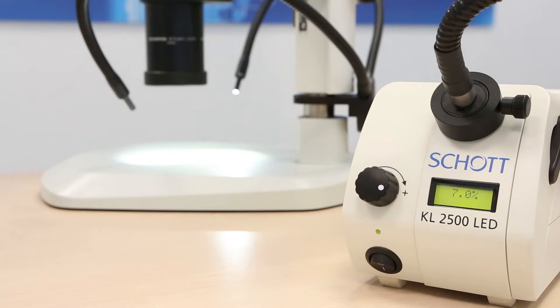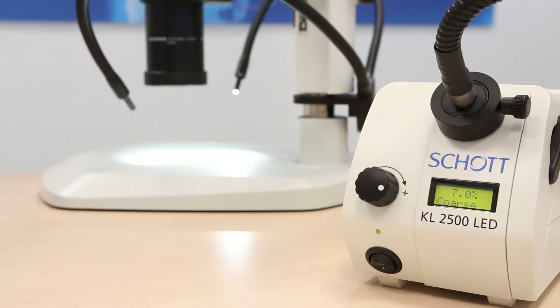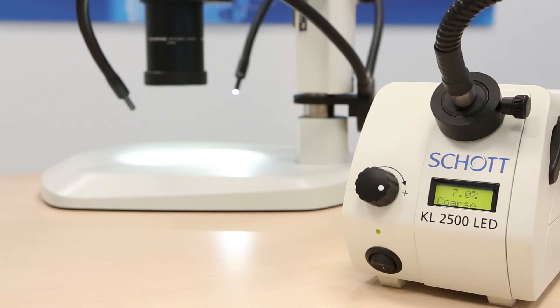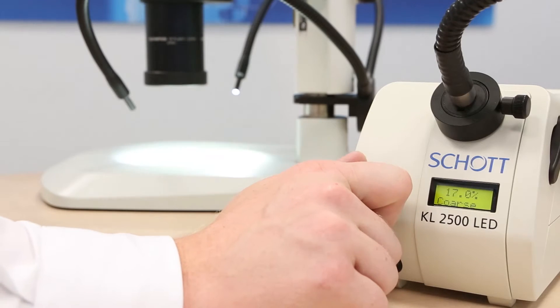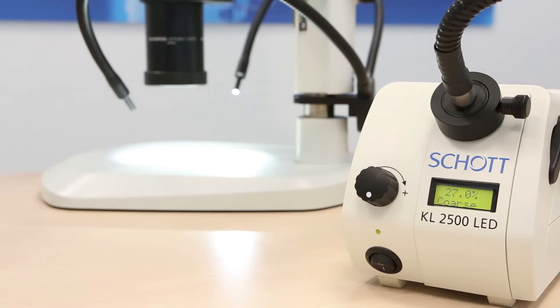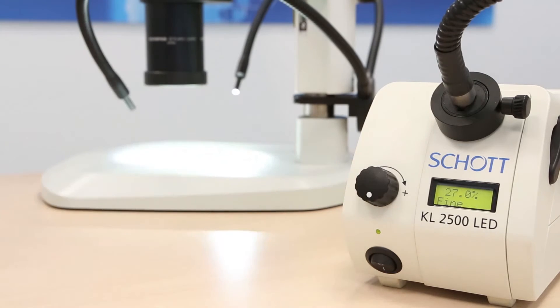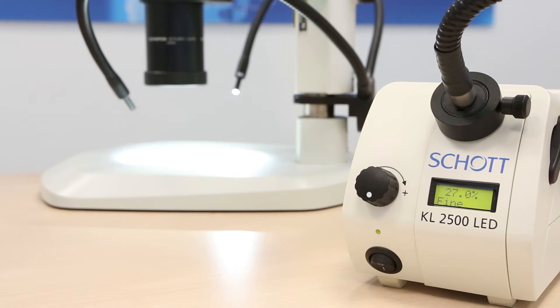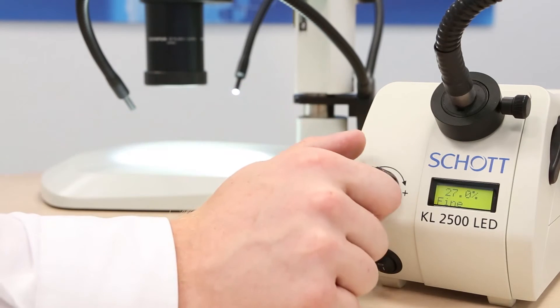Now if you would like to adjust the light in greater increments simply click on the button and you will find yourself in coarse mode. In coarse mode you are able to adjust the light in increments of five percent. Now if you are looking for a more precise way to work, click on the button once more and you are in fine mode, where you will be able to adjust the light in increments of 0.1 percent.